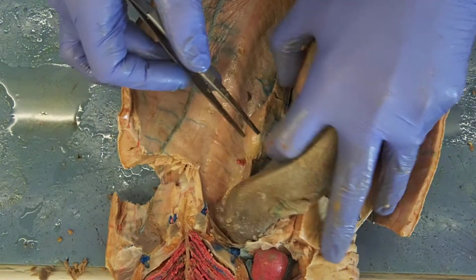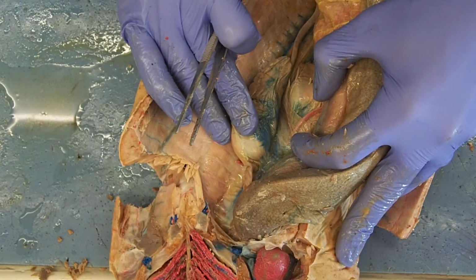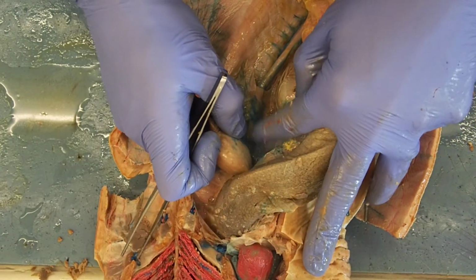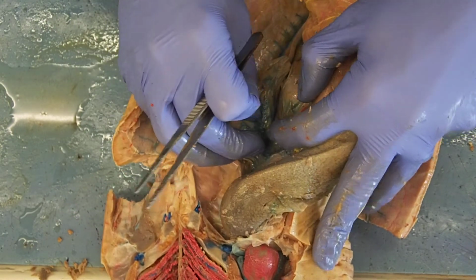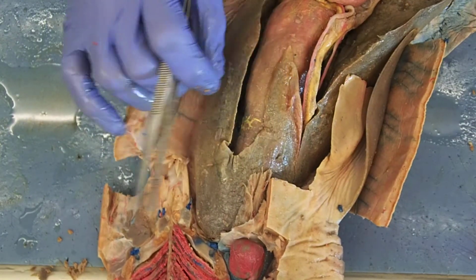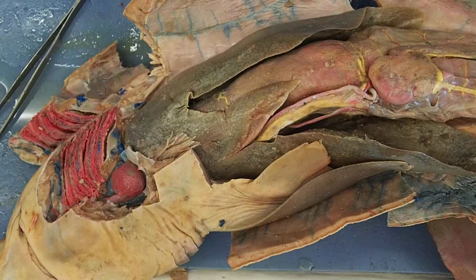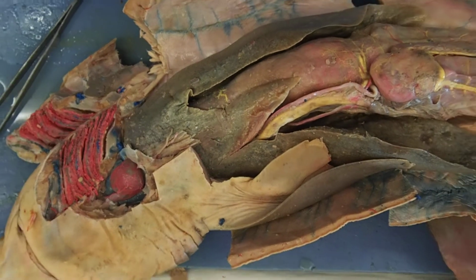Remember, eggs are shed by the ovaries. This is being held to the body wall via the mesovarium. Okay, that's this ligament in here, mesovarium. This is my ovary. Eggs are shed via the ovary into the body cavity. They have to make their way into the ostium tubae and then into the oviducts, where they'll then be fertilized once copulation occurs with a male. I'm going to go the other way.